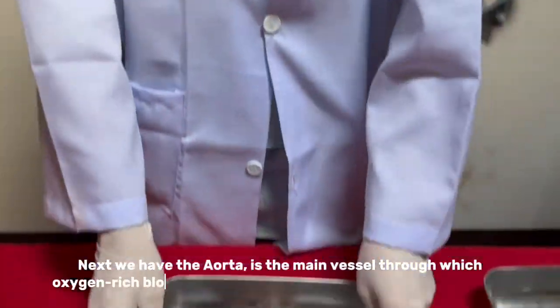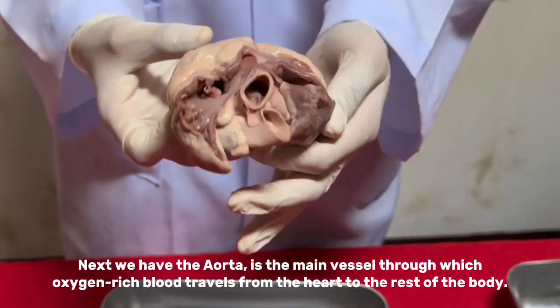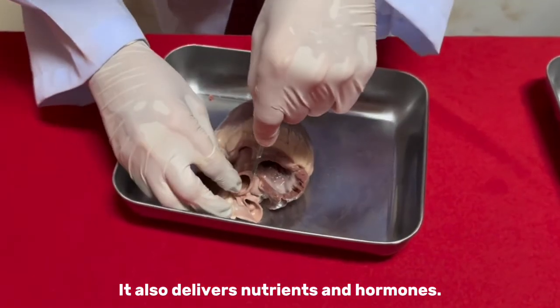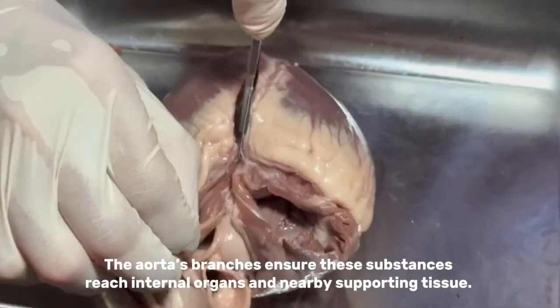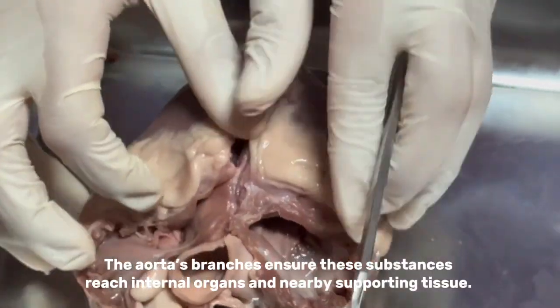Next, we have the aorta. It is the main vessel through which oxygen-rich blood travels from the heart to the rest of the body. It also delivers nutrients and hormones. The aorta's branches ensure these substances reach internal organs and nearby supporting tissue.